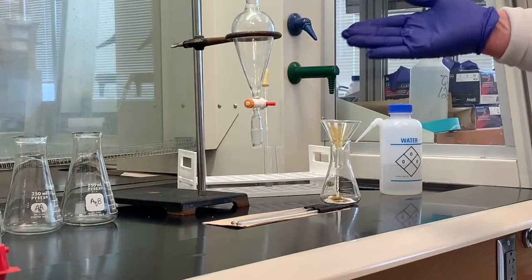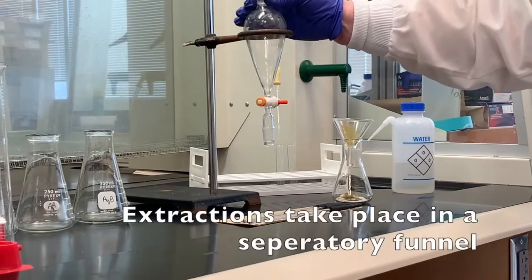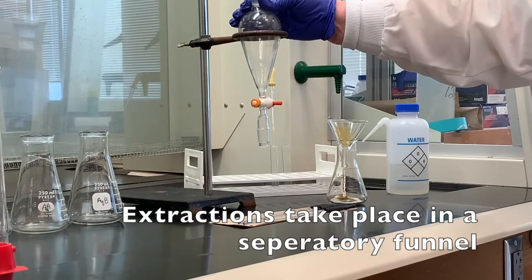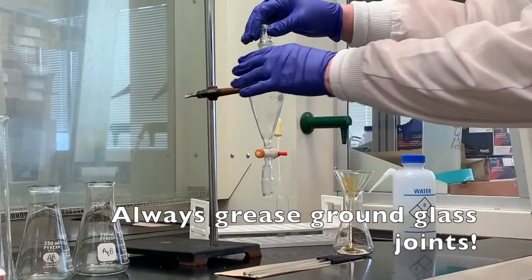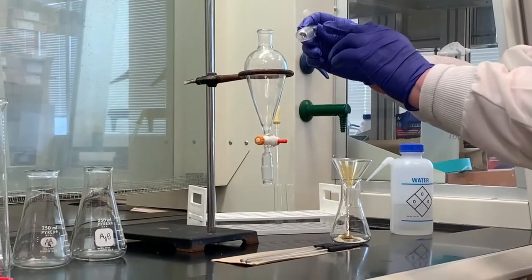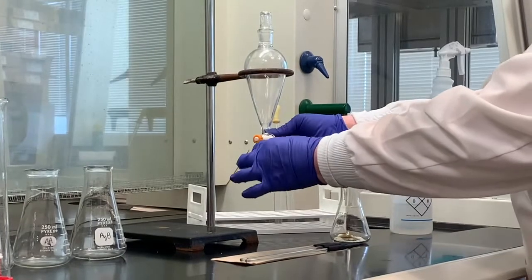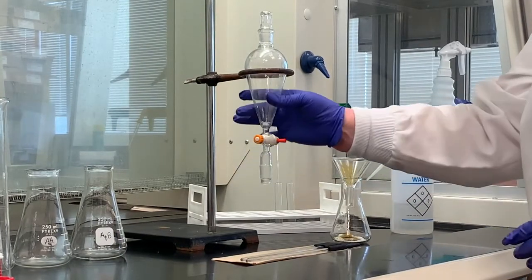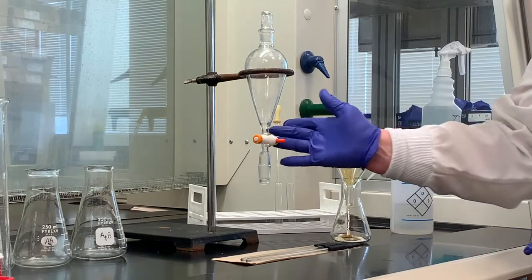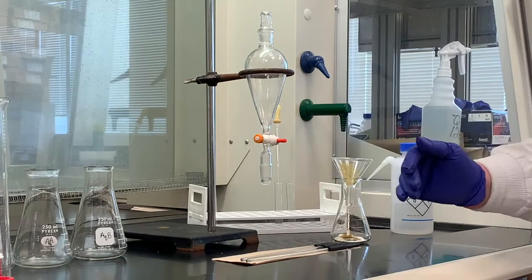This is not all the equipment, but this is what we need to get started. We're going to do everything in our separatory funnel as far as doing the extraction. Remember, this has already been greased. We have a stopper here. Very important that you grease that stopper before you begin. Always make sure this is pretty snug. You don't want it very loose. And before you pour anything in here, make sure that the stopcock is completely perpendicular to the separatory funnel. That means it is closed.